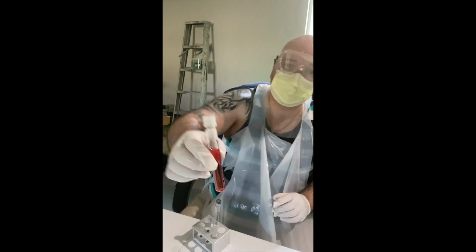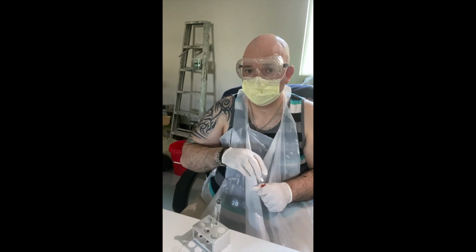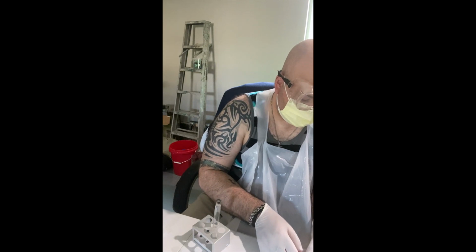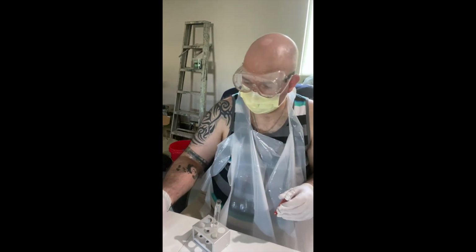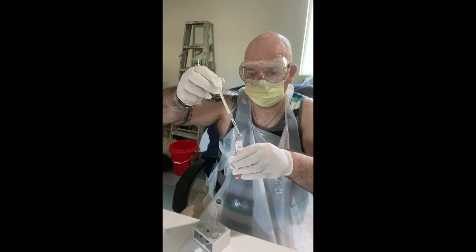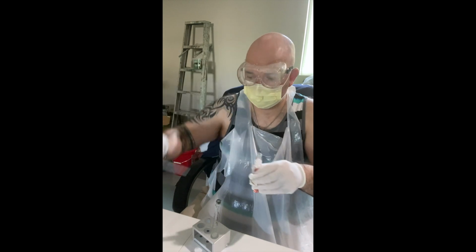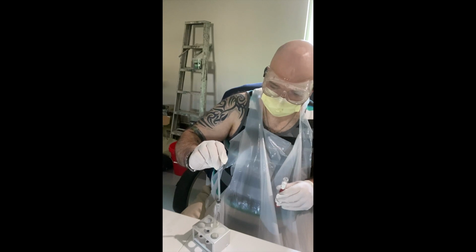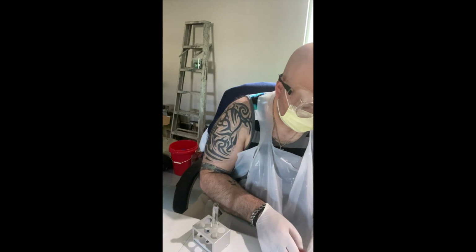And then lastly, this is my cerevisiae glucose tube. Lid off. Flame to sterilize. Okay, 4 drops. 1, 2, 3, 4. The remaining culture is going to go back in the tube. This goes into my bleach bucket. I'm going to flame this one last time.